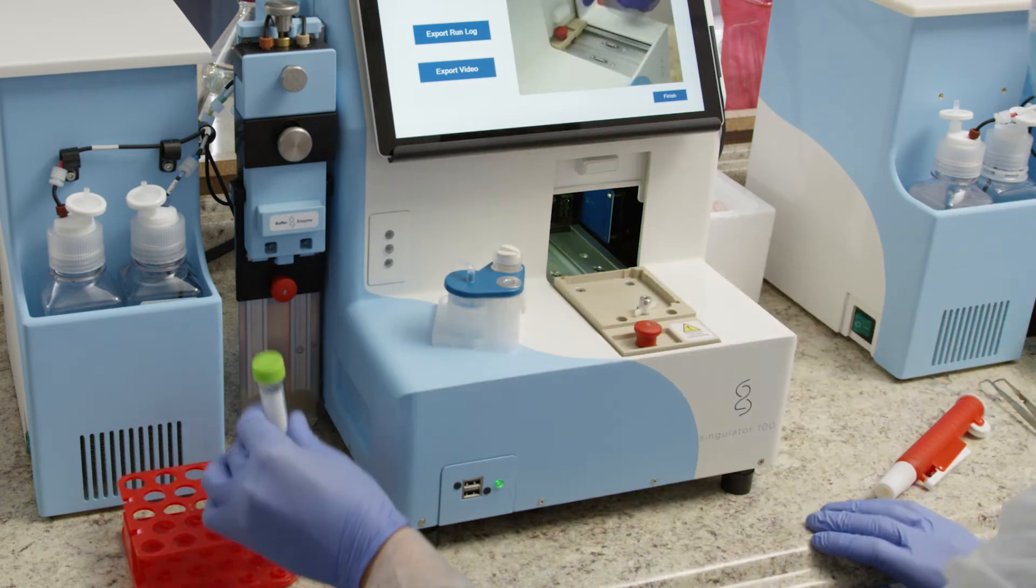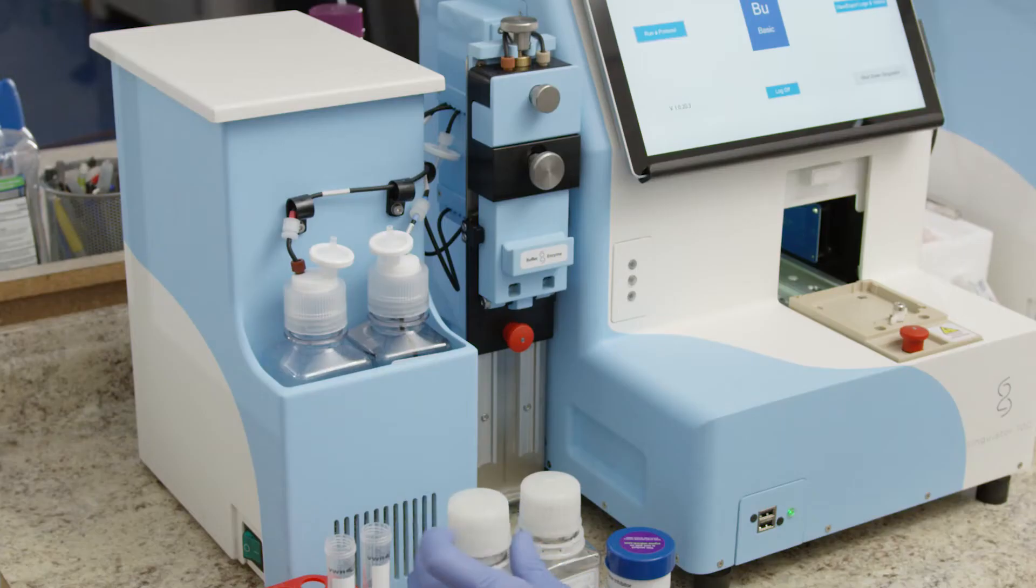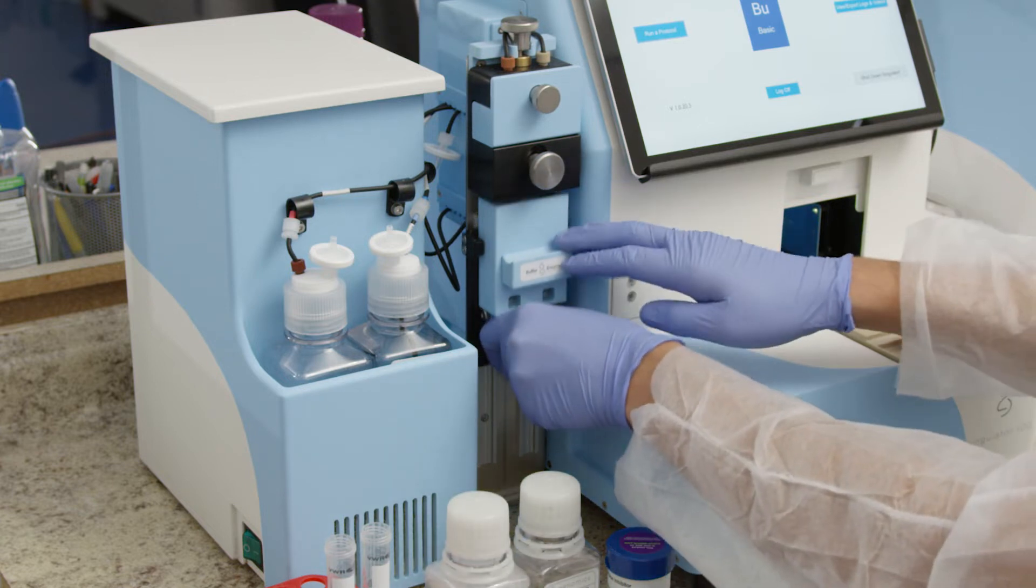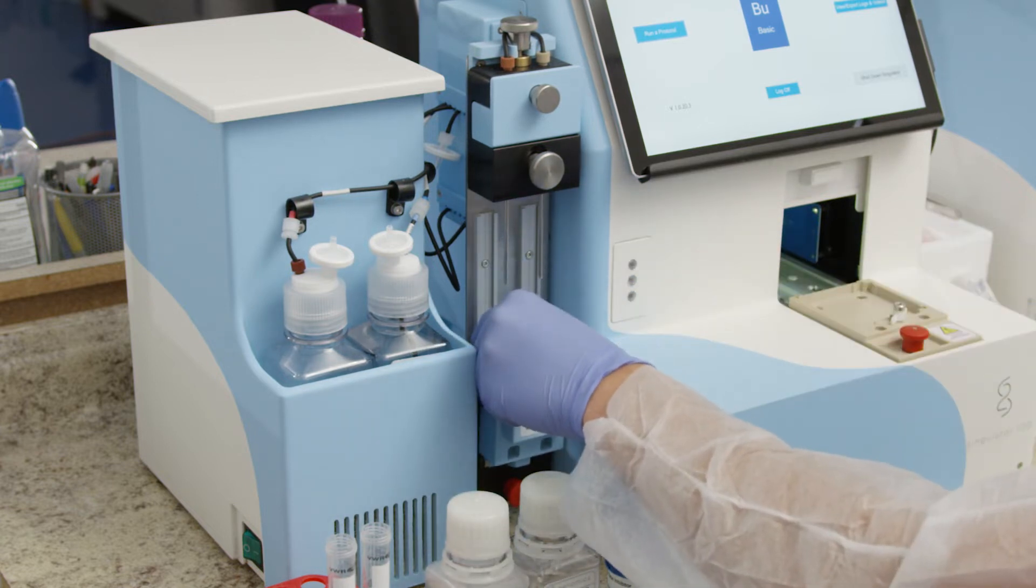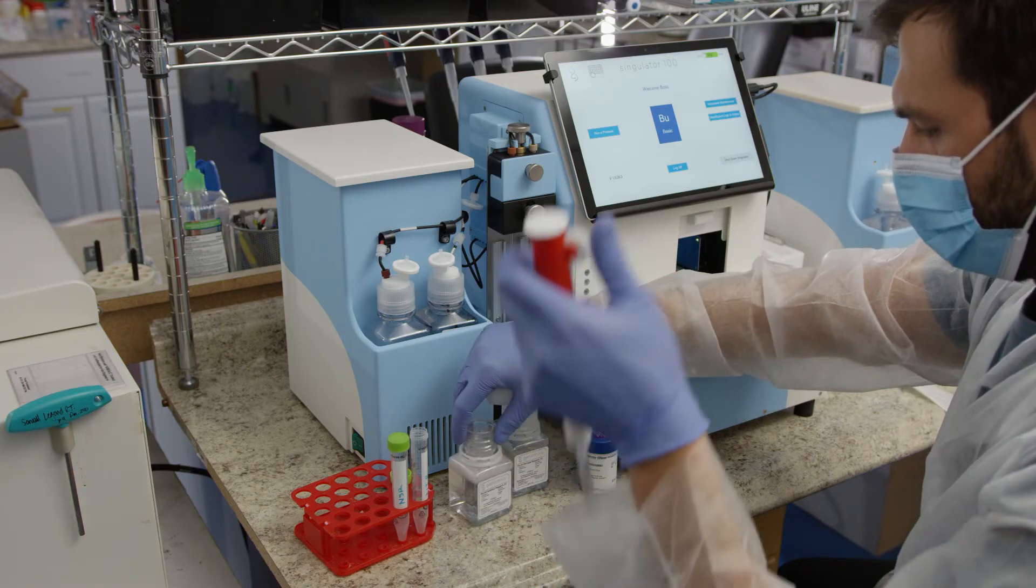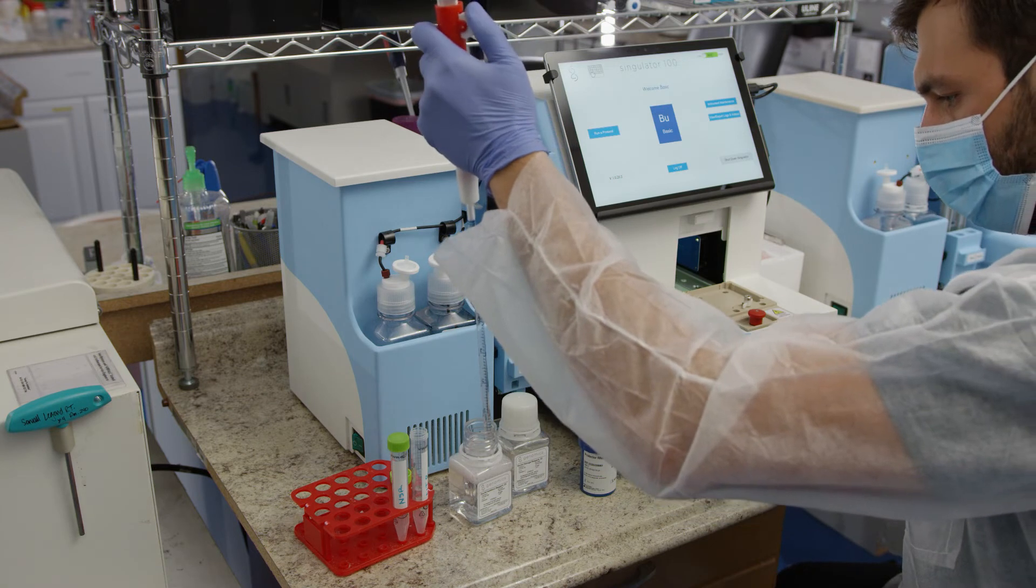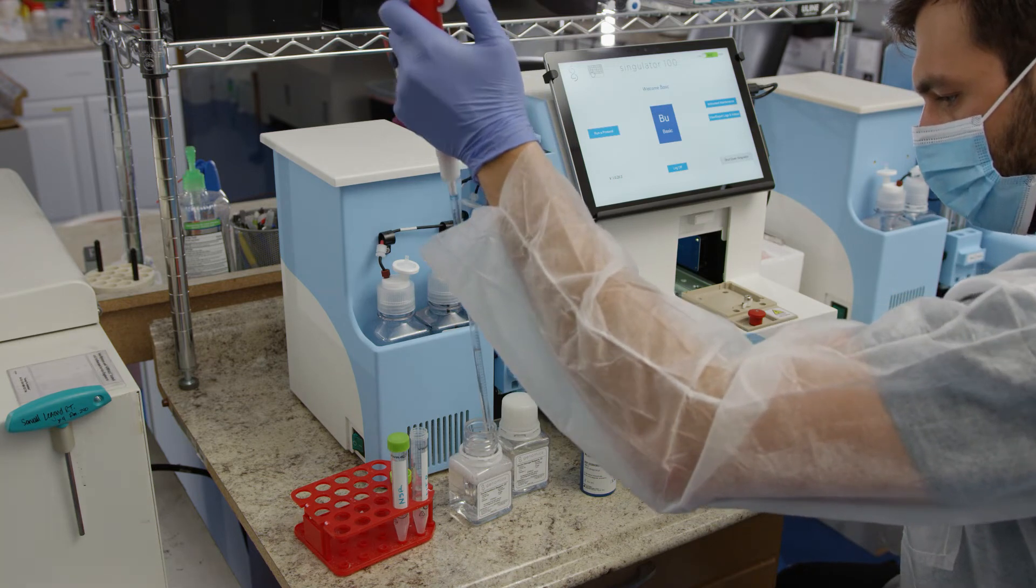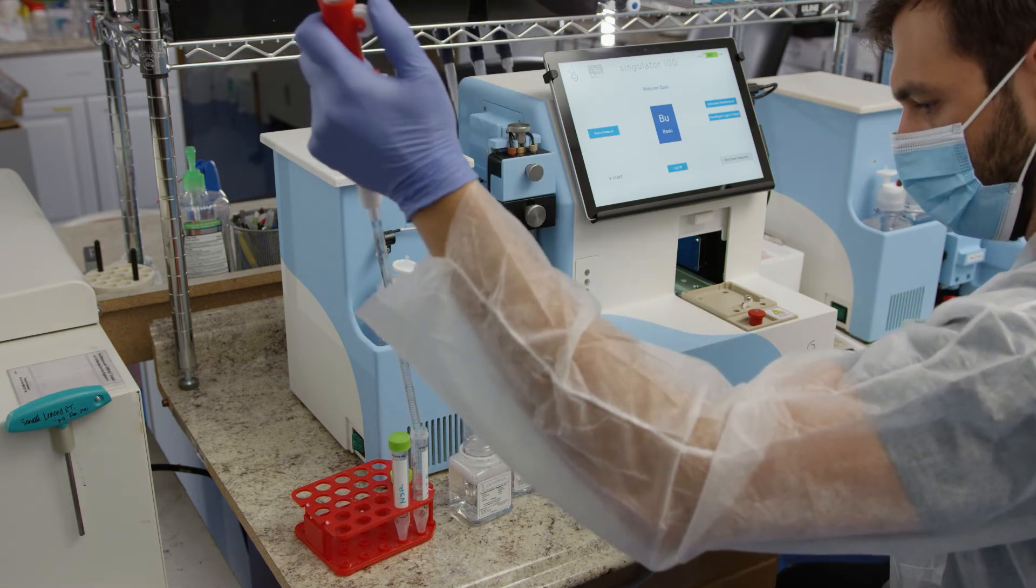If you select a protocol that uses the single shot mechanism for loading the nuclei isolation reagents, pull out the red knob on the single shot mechanism and lower the reagent delivery stage. Pull out the blue handle to tilt the tubing chambers toward you. Load 3 milliliters of NIR into a 15 milliliter conical tube.